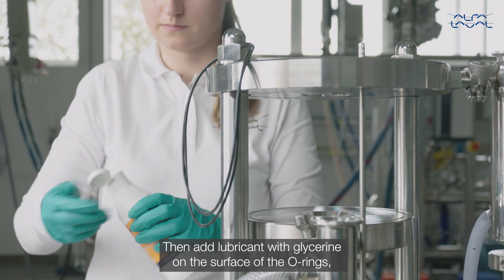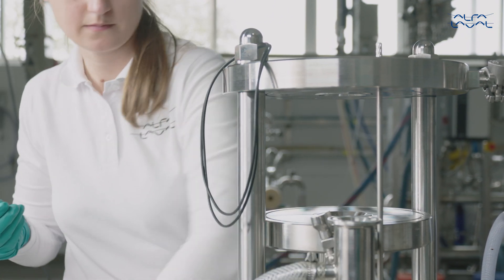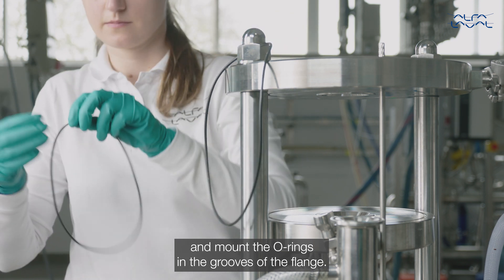Then add lubricant with glycerin on the surface of the O-rings and mount the O-rings in the grooves of the flange.